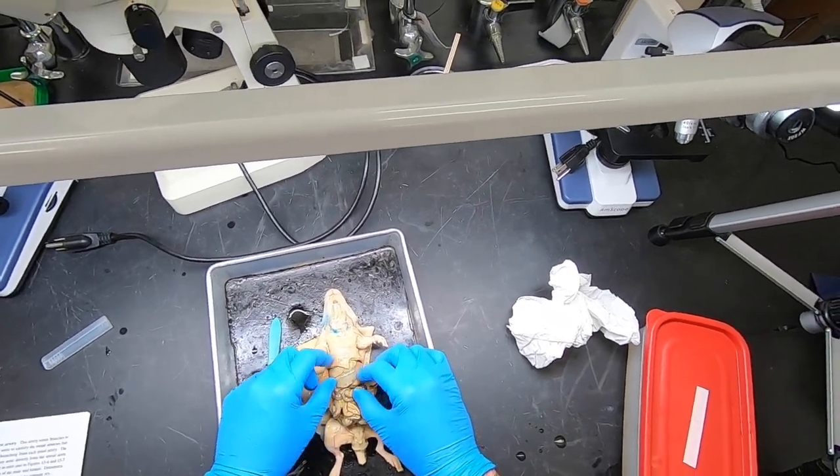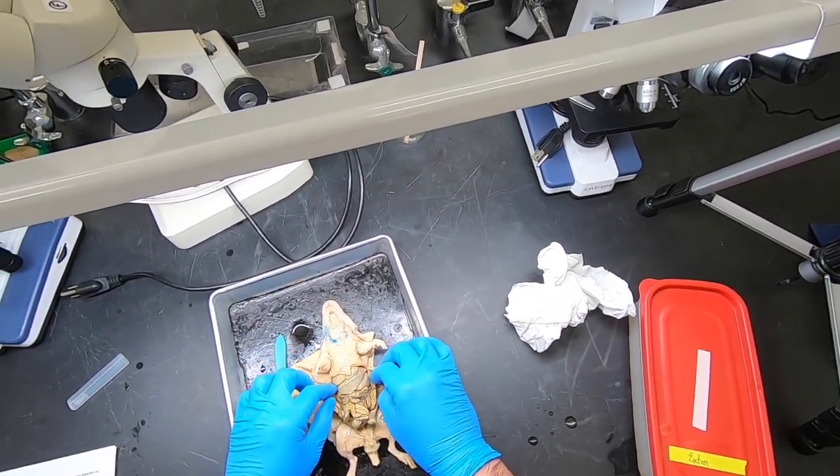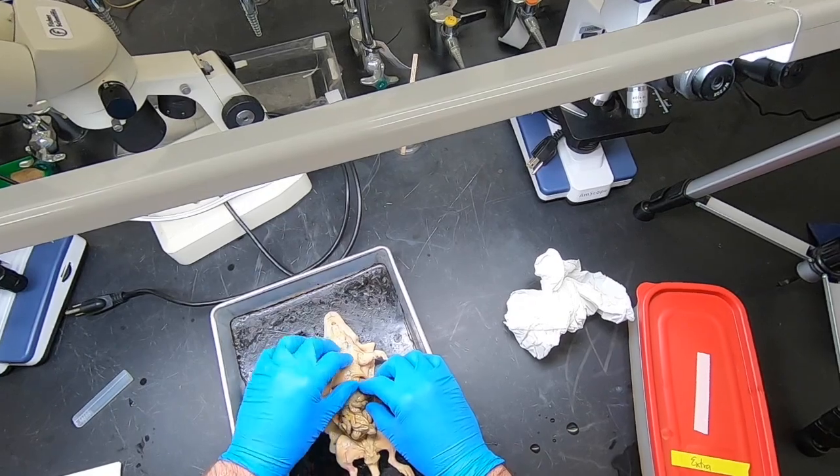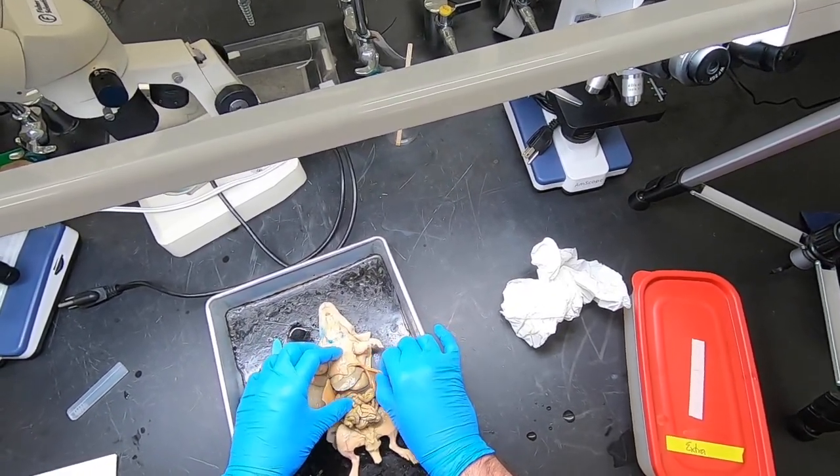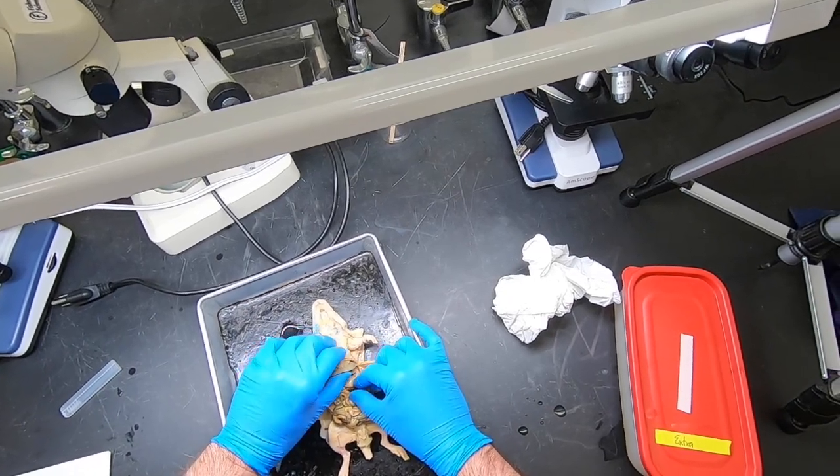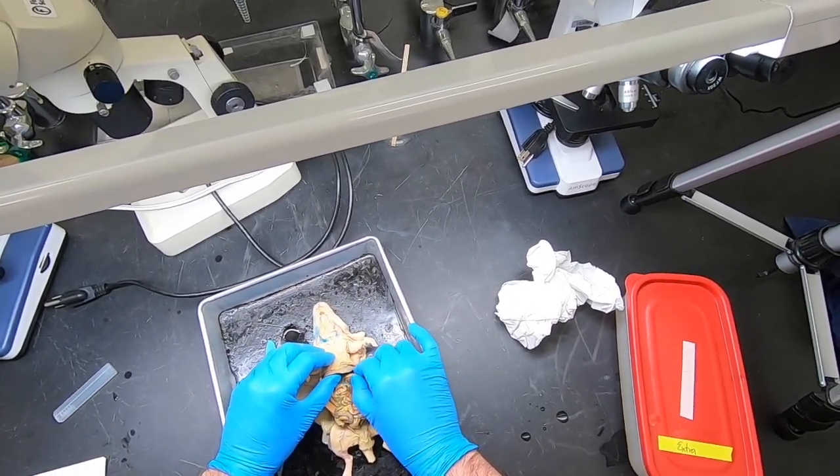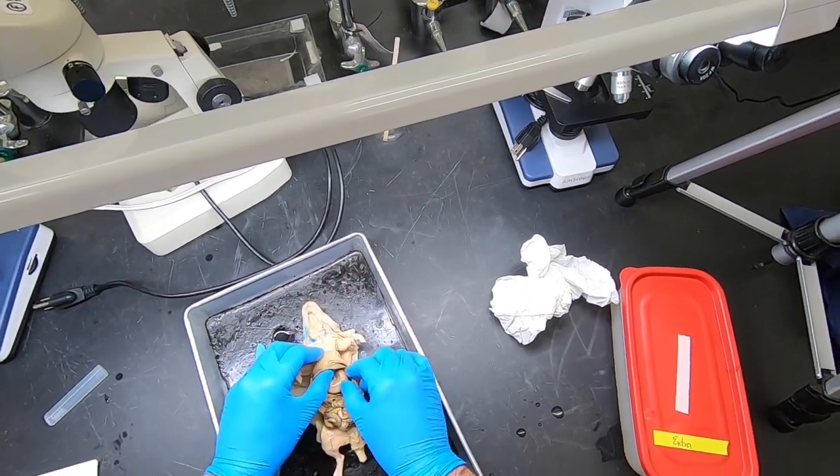All right, so let's see what she's got. A liver, just like the male rat had a liver, with multiple lobes. If we look under the liver, we will find the stomach. Here is the stomach.